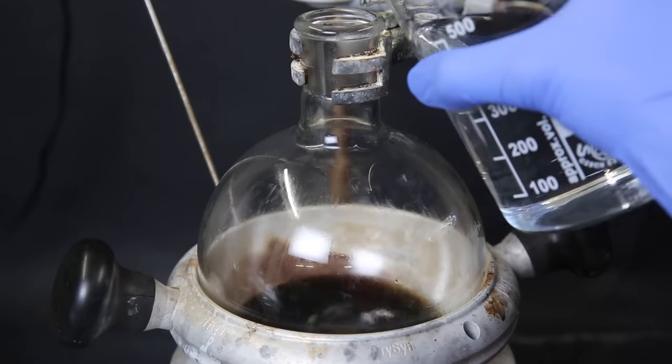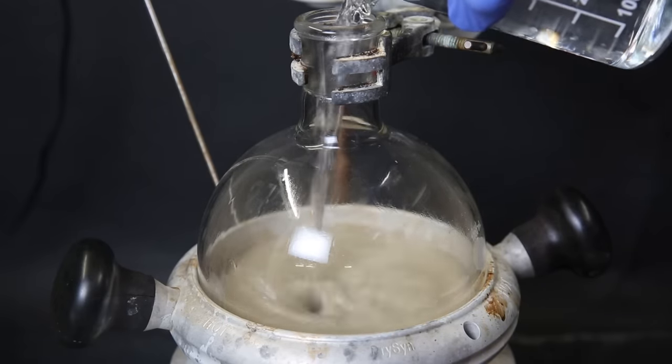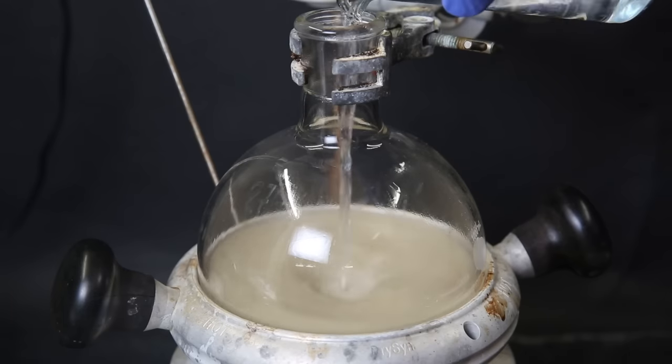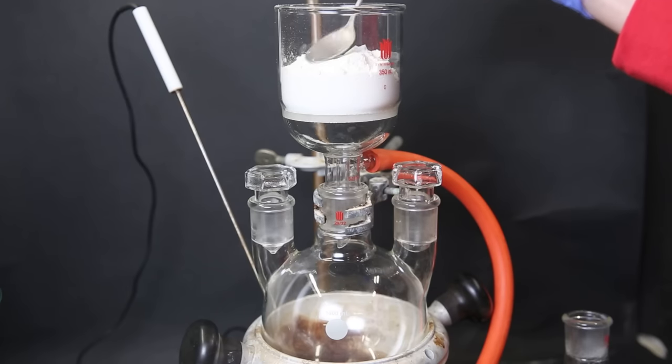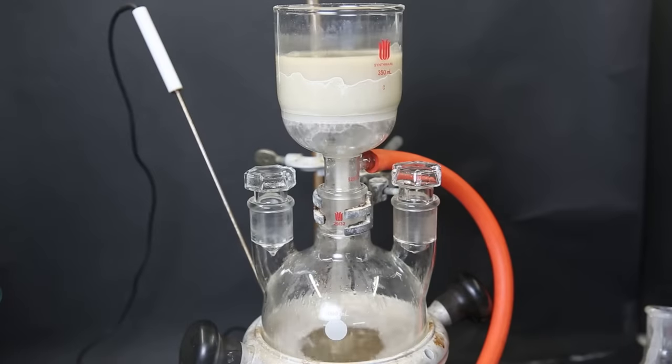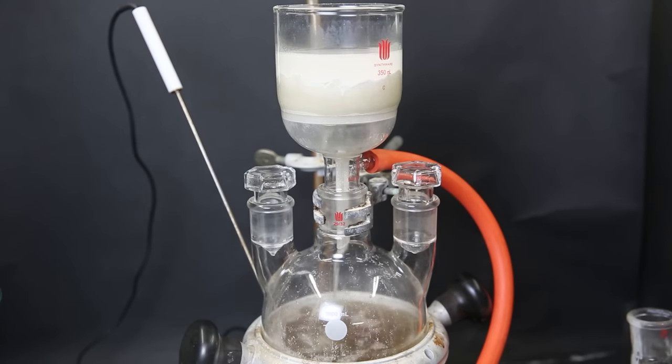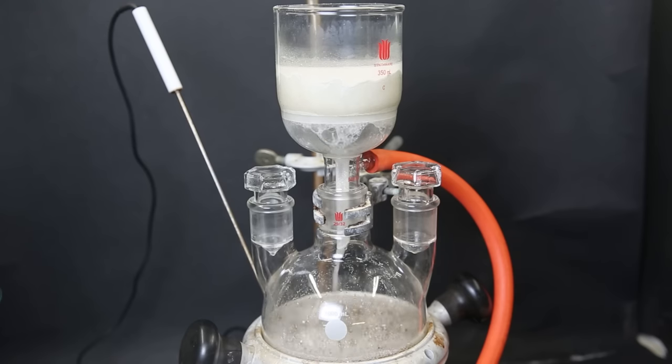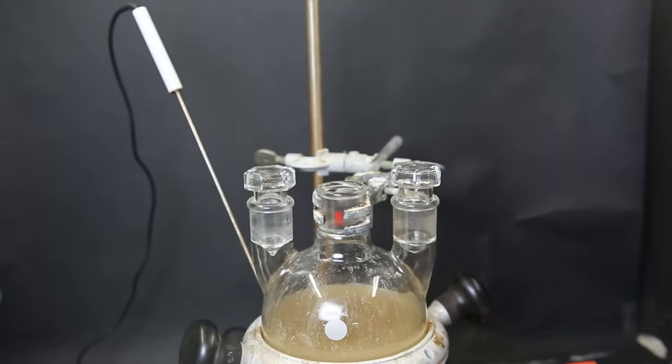We can immediately see lithium bromide is suspended in the mixture, but the particle size is so extremely small that it has to be filtered more intensively. So I set up a glass filter and packed some celite on top to get out the larger particles first. I then turn on the vacuum and filter all of the mixture through. I wash it with some DCM, and we can see that the filter still has lithium bromide particles due to its cloudiness. So it has to be filtered through an even finer filter material. So I remove the filter and clean it out, and then repeat the same process.